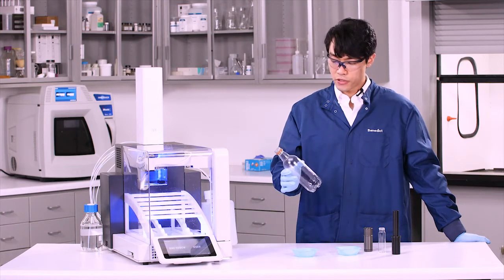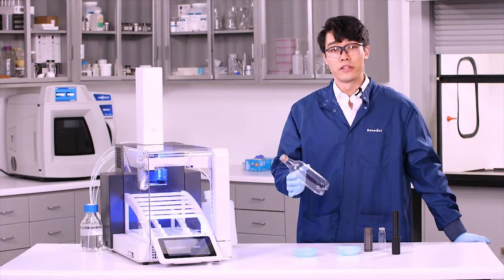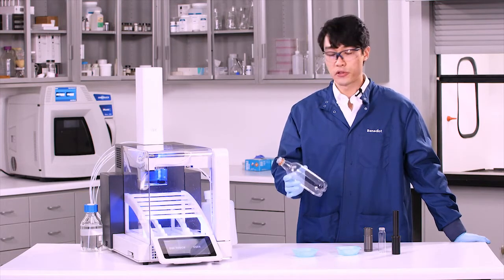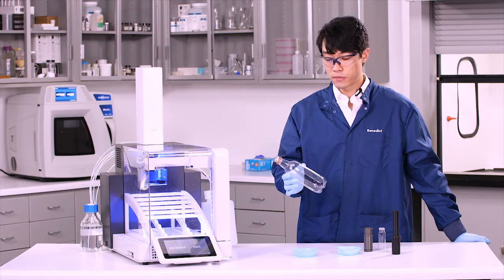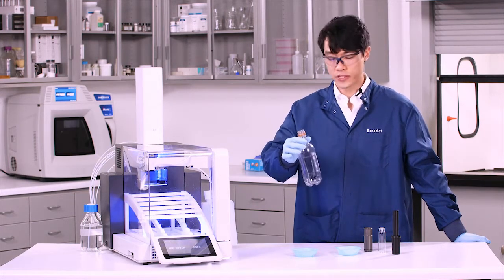Well, first thing we got to do is reduce the sample size so we can fit this into the Q-cup. So to do that, for most plastics, you either want to grind, cryomill, cut, or... I've heard of something. Let me give it a shot.